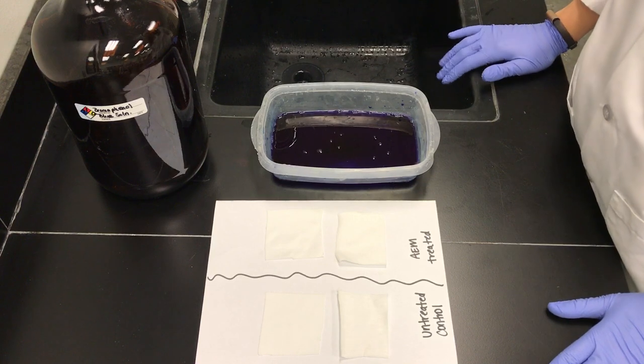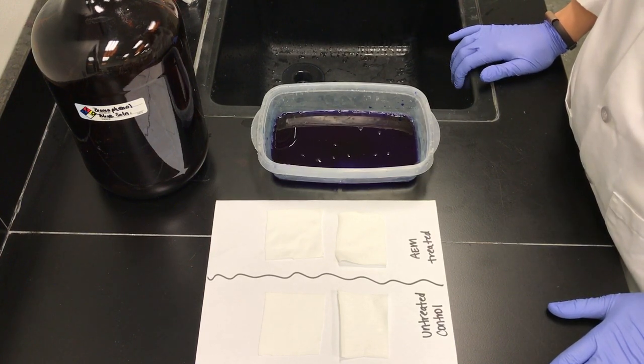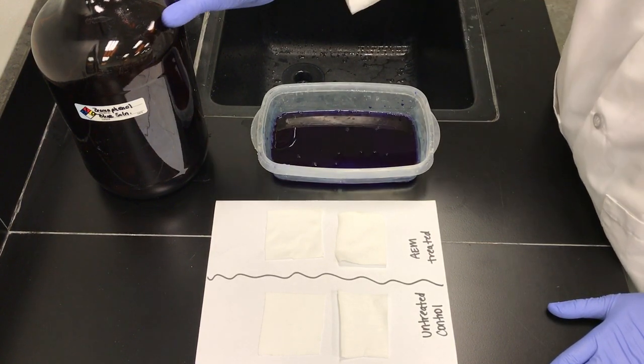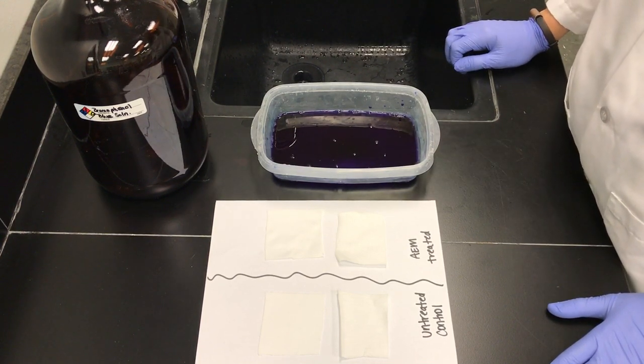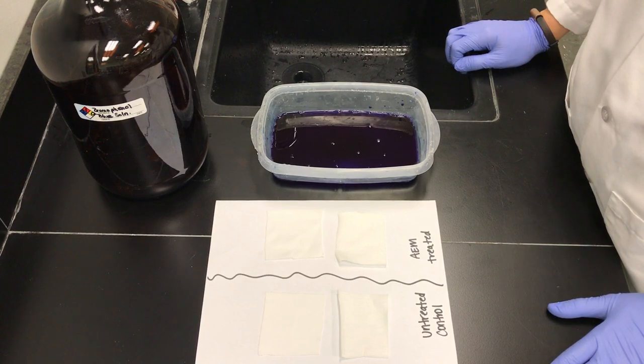This solution can be used for multiple samples. If you need to reuse the solution later, please store in an amber bottle or a light-sensitive bottle. The BPB solution is sensitive to light and will photo-degrade.